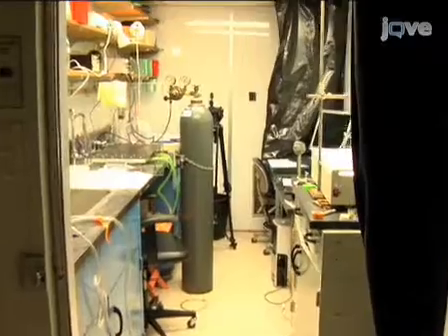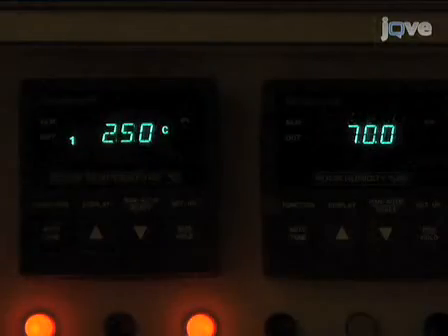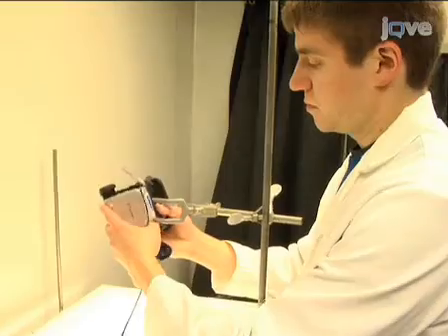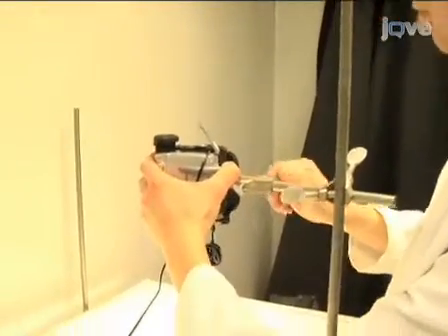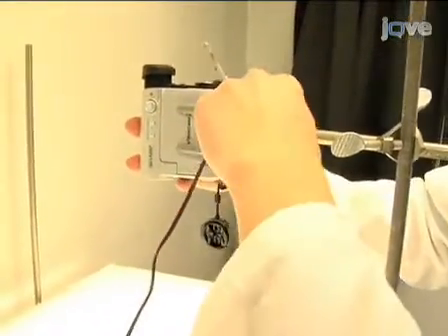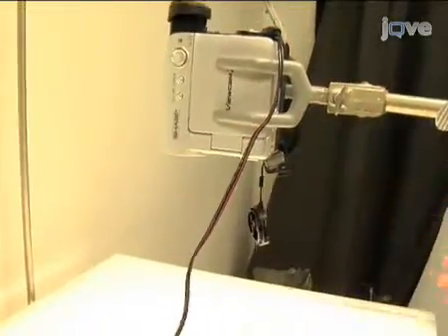The video tracking experiments are done in an environment room, which maintains a constant temperature of 25 degrees Celsius with 70% humidity. To videotape flies in motion, you'll need to suspend a digital video camera over the area to be recorded, with the camera facing downwards. We suspend the camera over a light box, since our tracking software is contrast-based.